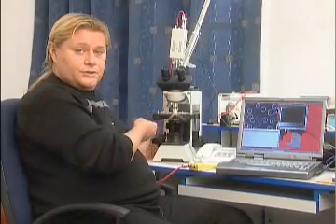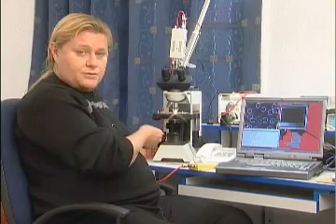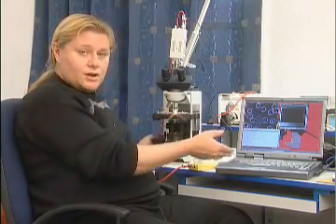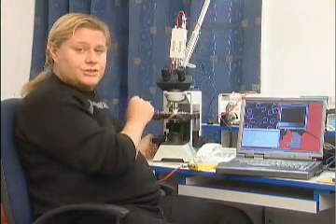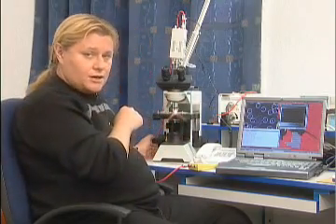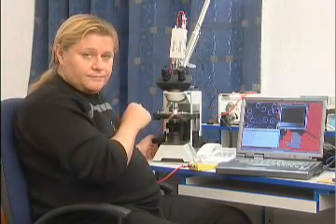We have our dark field or phase contrast microscope hooked up to our computer to be able to analyze the patient's blood with the computer technology and to take a look.